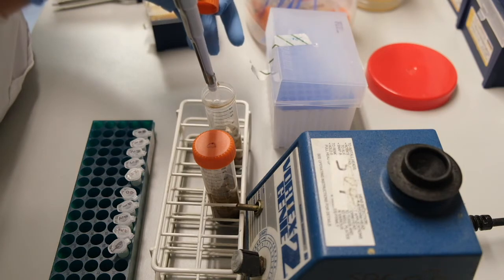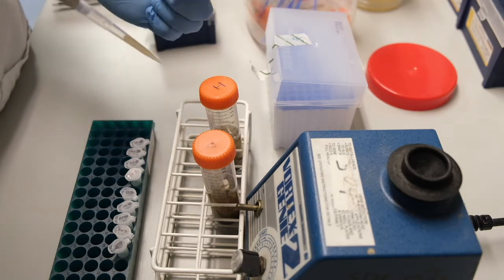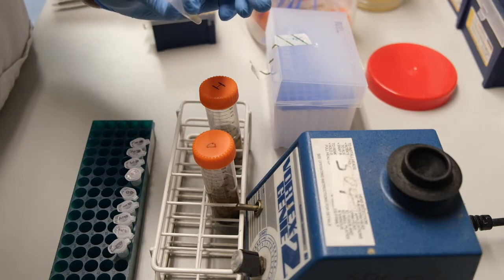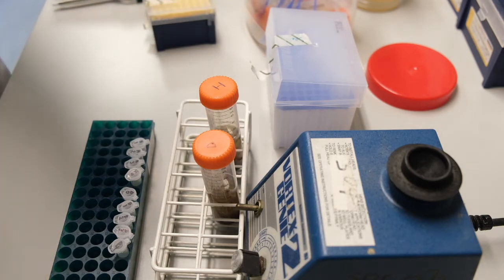Avoiding the solid lumps at the bottom, I take 500 microliters or so of the soil sample and place it in the undiluted tube. We will now start our serial dilution from this sample.